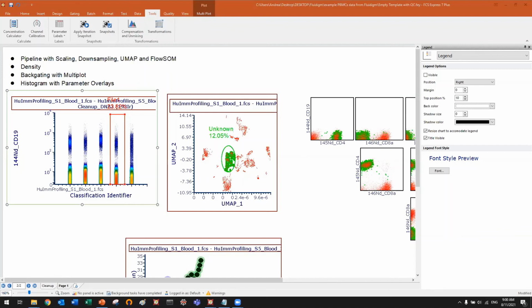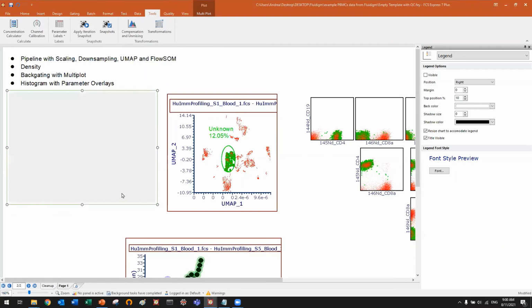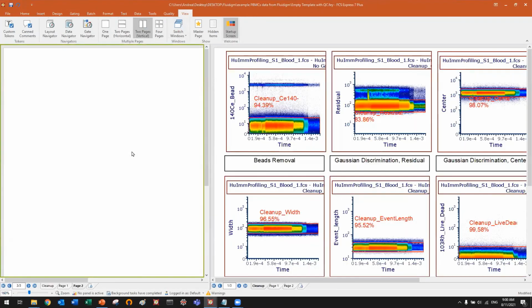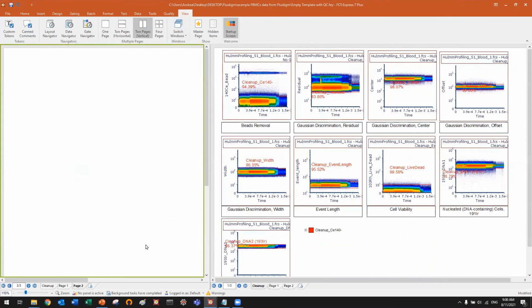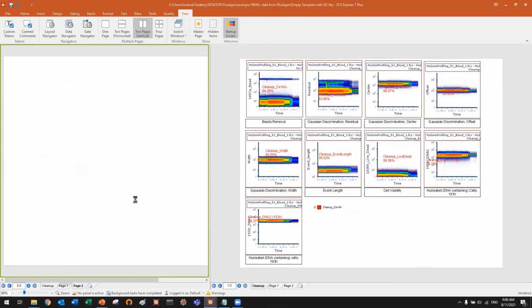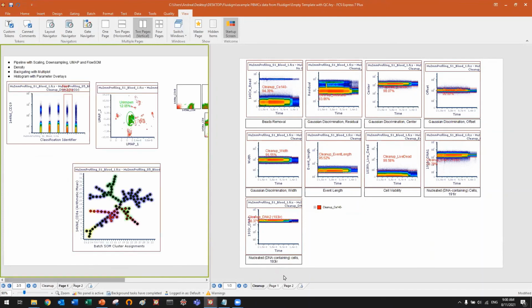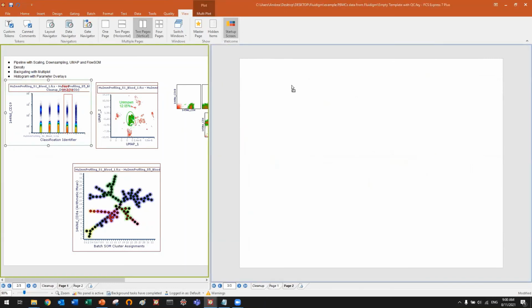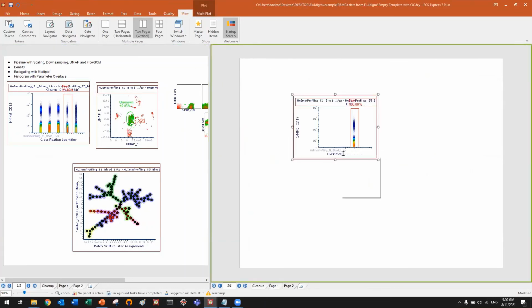Can one plot on page 1 be connected with a plot on another page? That's already done. I can show you. I can open up page number 2. I can view 2 pages at a time. Okay, let's do the following. On the left, I have page 1. And on the right, I have page 2, which is now empty. Let me show you. I will, for example, open a plot by drag and drop. Now I will display UMAP here.